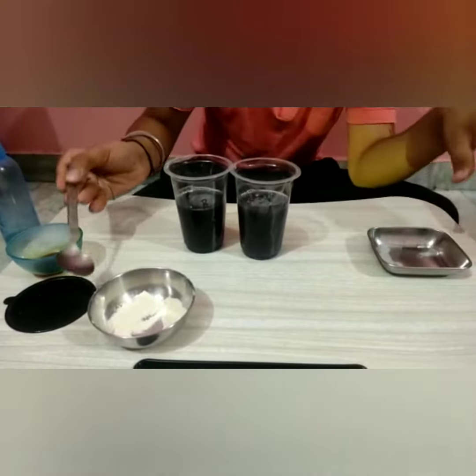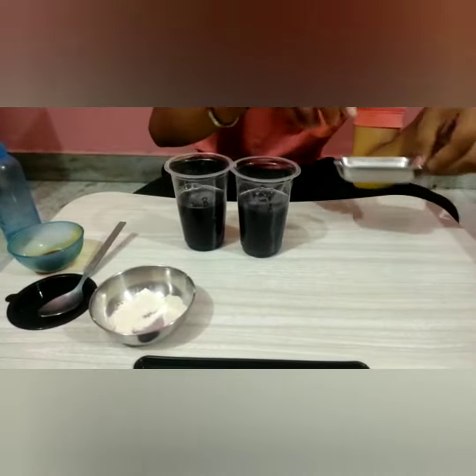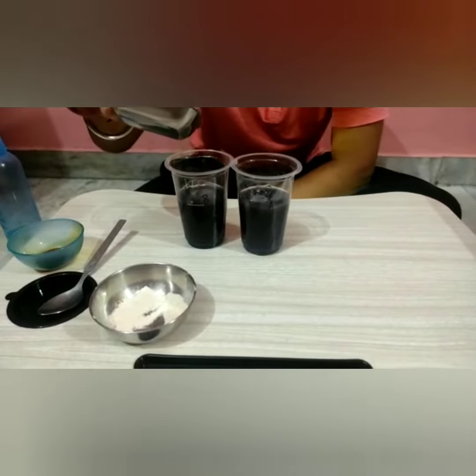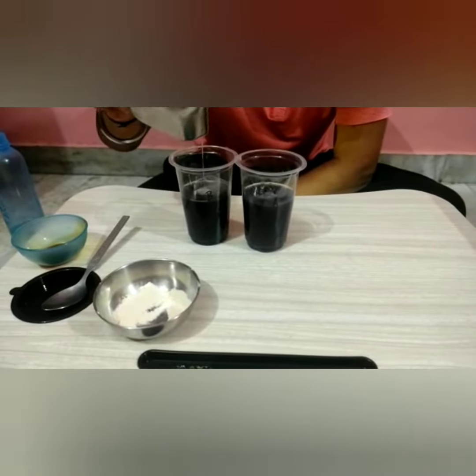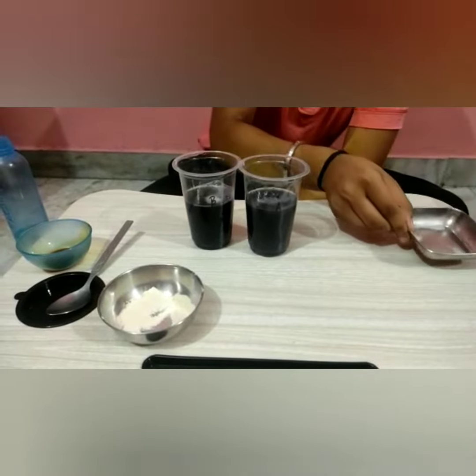Then we add some saliva of human beings into glass B. After some time, we check it.